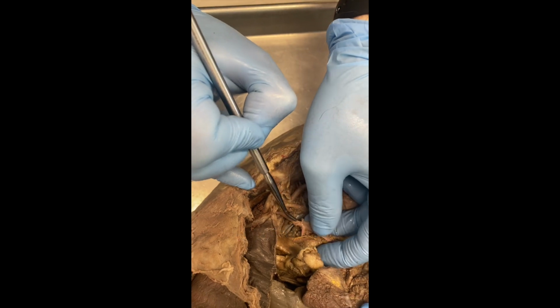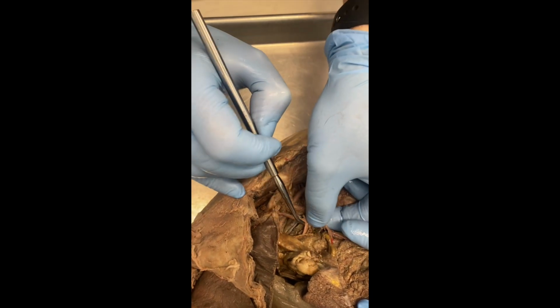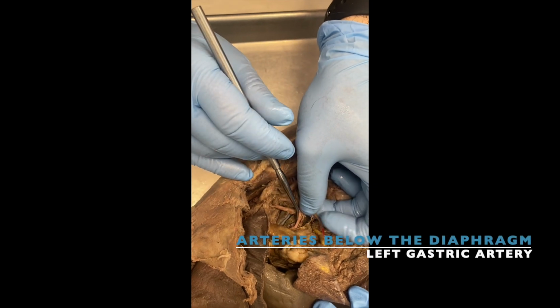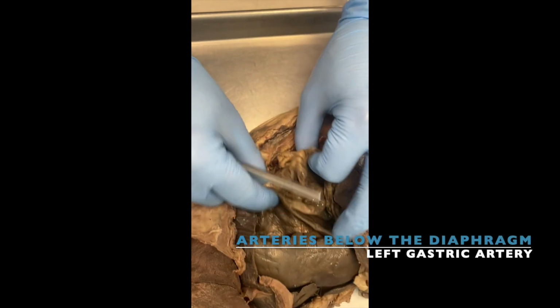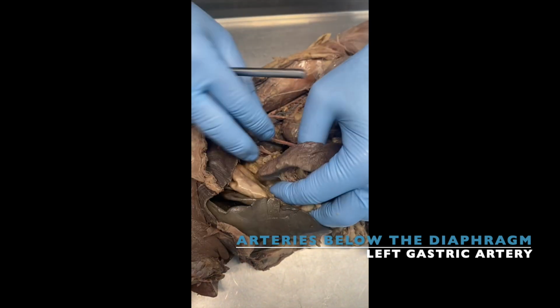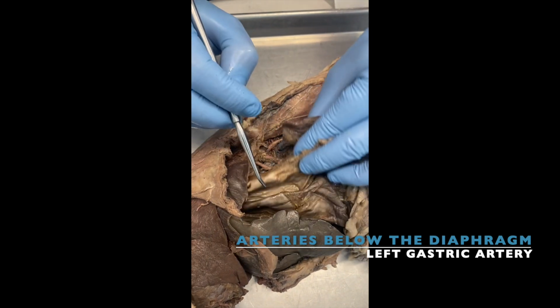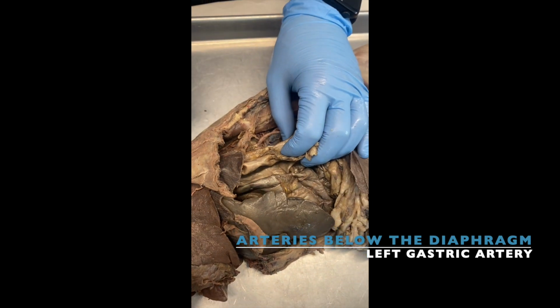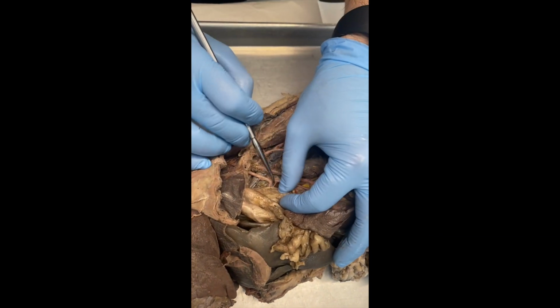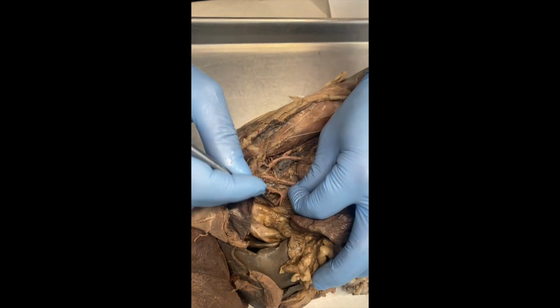In some other cats, you can see it much better. But this one is your left gastric artery, okay? Because it's going to your stomach. So this is the stomach of the cat. So the artery that goes to your stomach is called the gastric artery, okay? Left gastric artery. I'm sorry that we don't have a good hepatic in this guy.